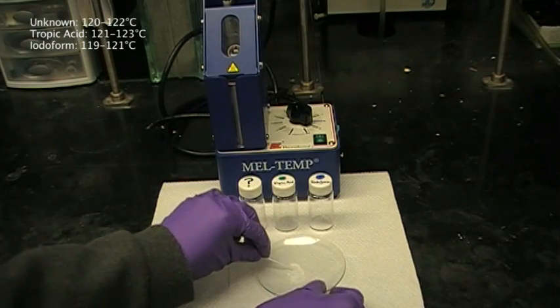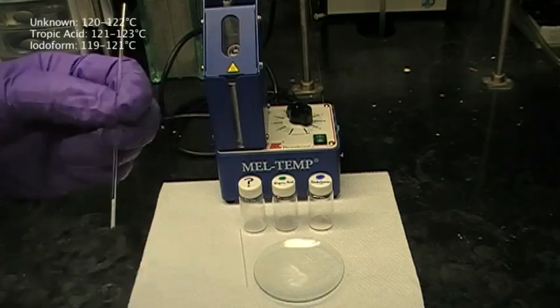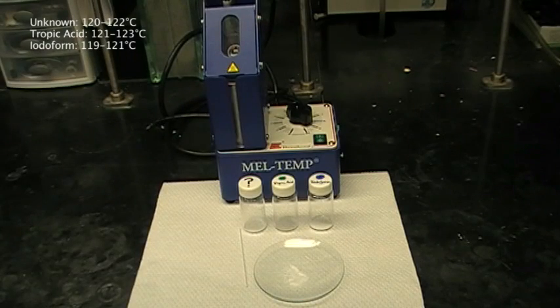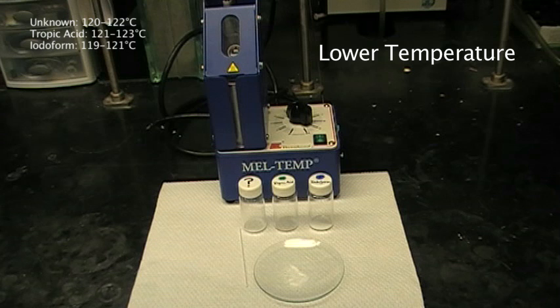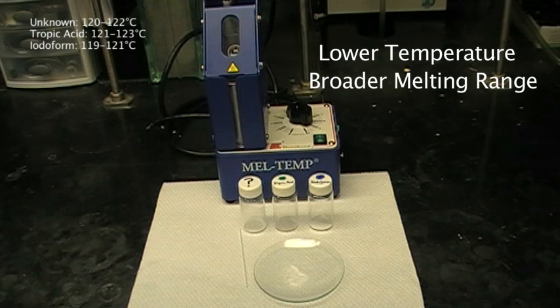Then we're going to load it into a capillary tube and measure the melting point. We find that the mixture of tropic acid and unknown melts at a lower temperature than 120 degrees Celsius and has a broader melting point.